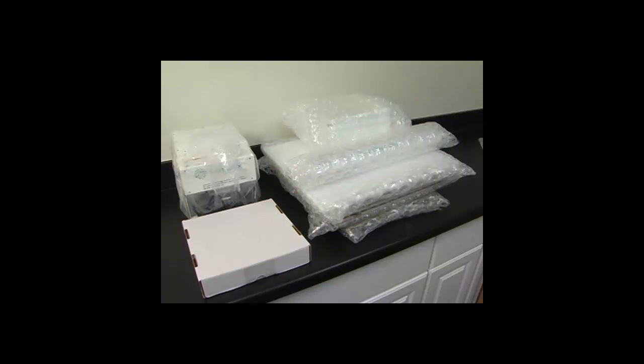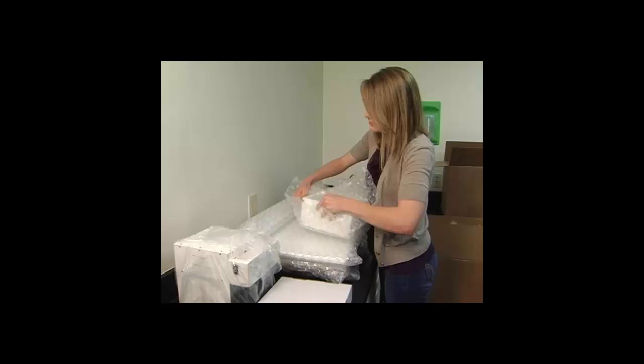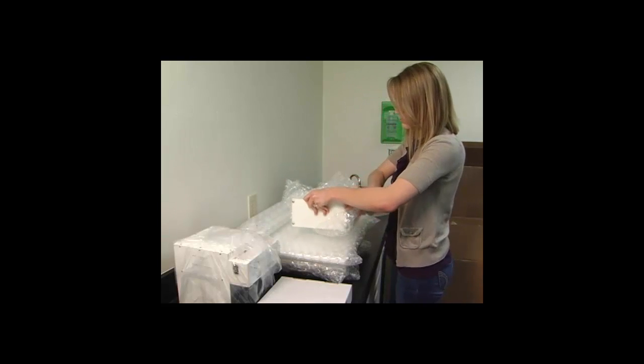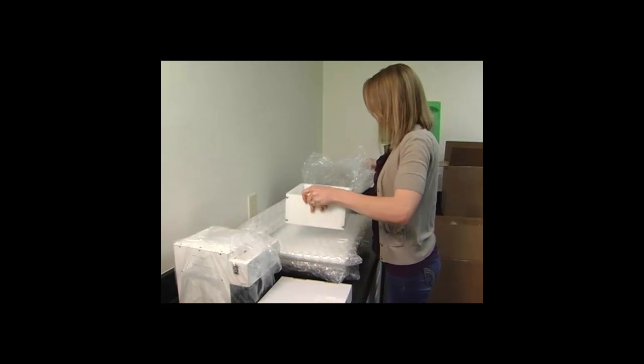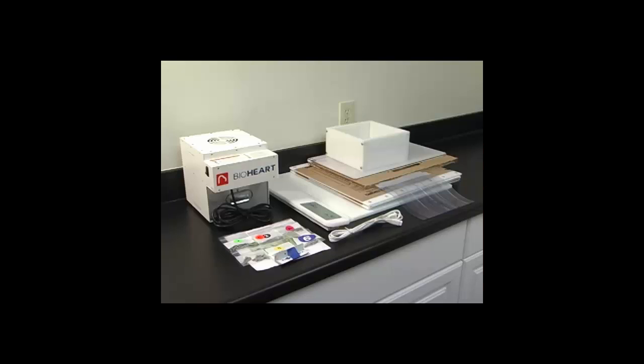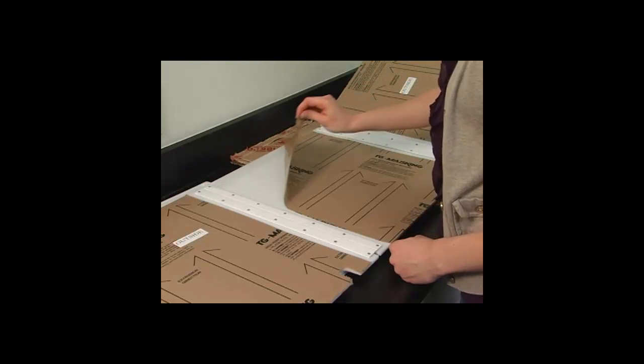Begin by carefully removing the system from the packing material. As you remove each part, inspect them for any damage that may have occurred during transport. If damage has occurred, stop assembly and contact the freight carrier immediately.